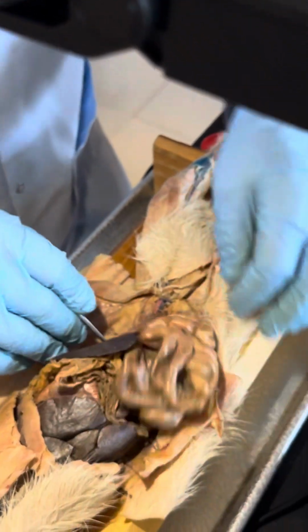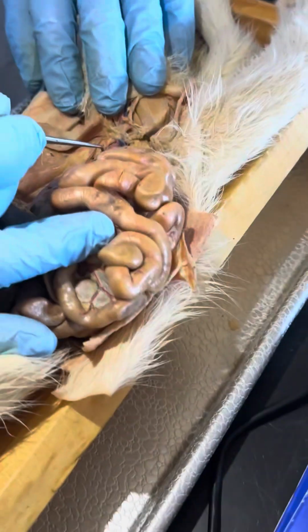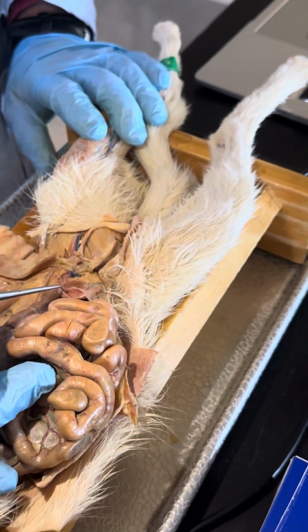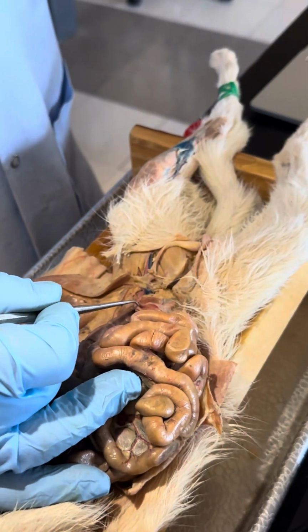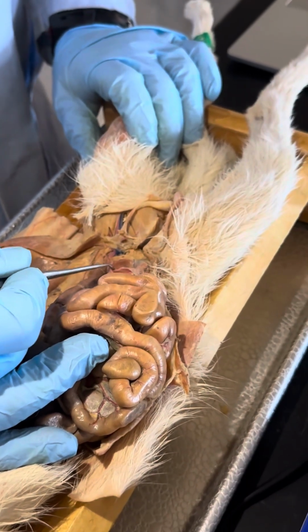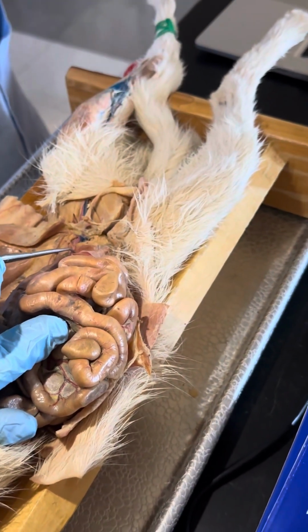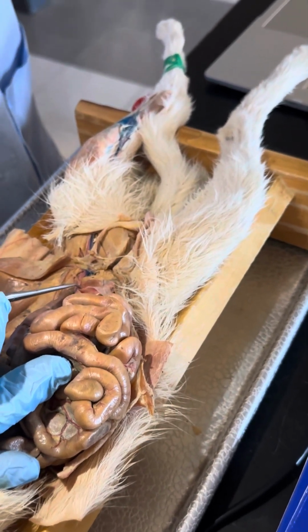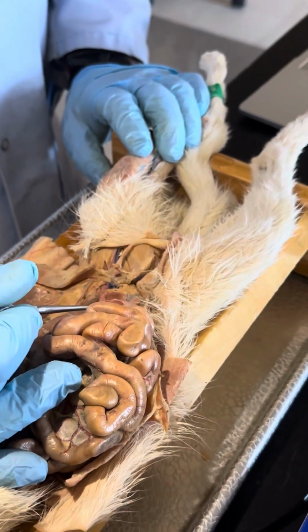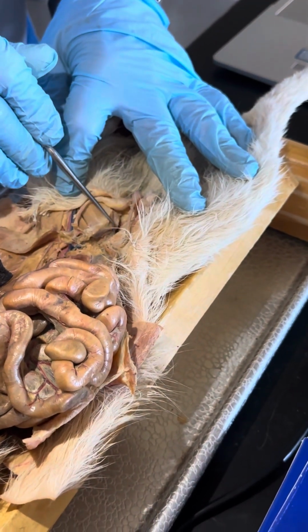We got the urinary bladder. The urinary bladder will be in one of two configurations. It'll either be really flat, like a party balloon that doesn't have any air in it, or it will look like a grape, and it'll be kind of hard, and sort of more three-dimensional. If it's flat, it's because the urinary bladder was full when the cat died, and then it gradually emptied, but the muscles were all stretched out, and since they were dead, they don't contract. If it looks like a grape, then the urinary bladder was flatter when it died.